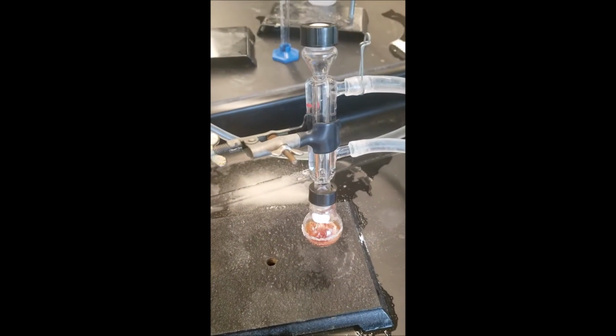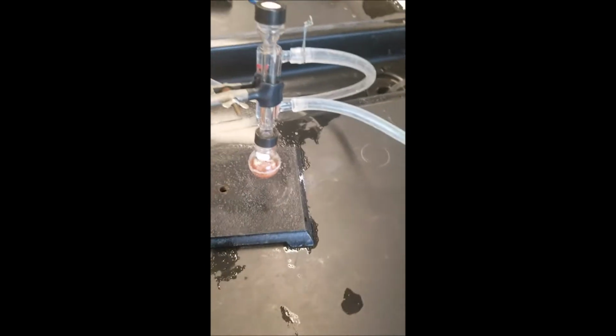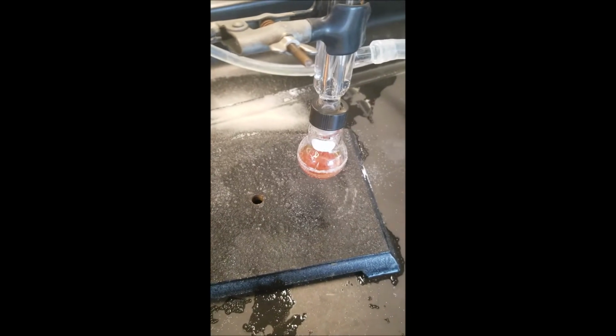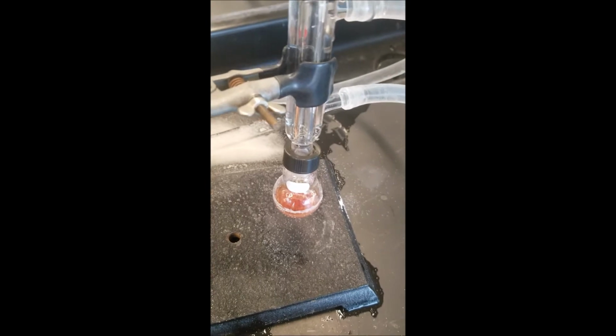There's not a really good way to tell how long that heated for. So now I'm letting this cool down to room temperature before I add in the water. I think I heated this for long enough. We will see. We will see. There's been some goofs here and there, so I don't know. If this doesn't work, well, we'll be doing it again.